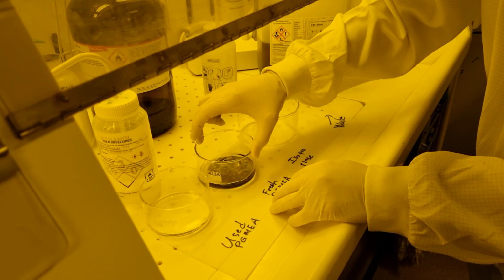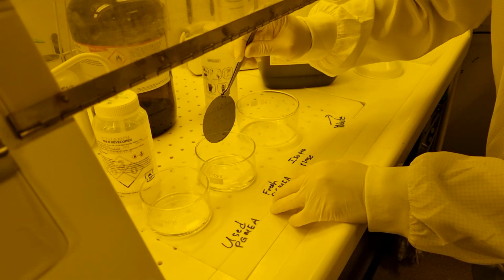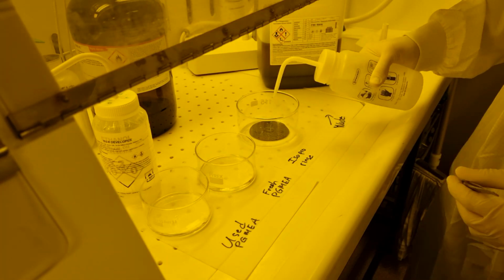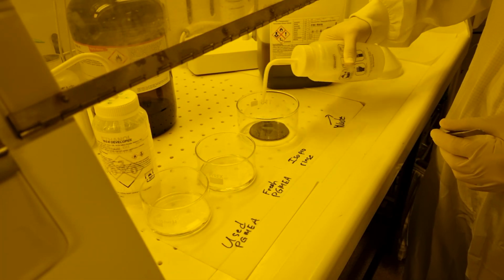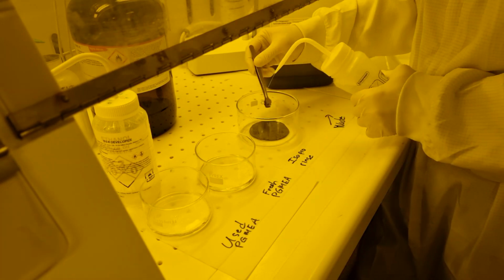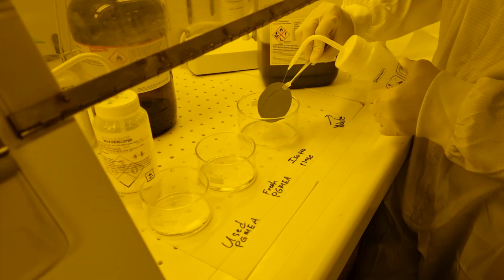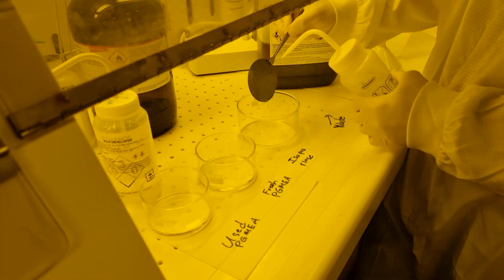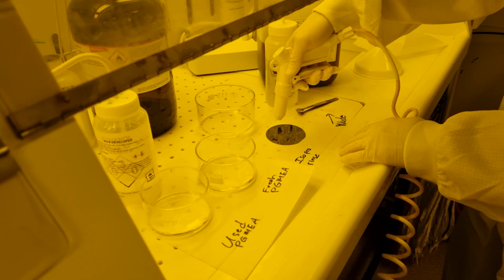When the last bit of resist has cleared, immediately move the wafer to the dish of new PGMEA. Agitate here for about 30 seconds, and then move the wafer to the final dish and begin rinsing with isopropyl alcohol. You must rinse your tweezers to prevent PGMEA residue from staining the wafer where you grasp it. Blow dry the wafer with the compressed nitrogen and inspect your pattern on the microscope.